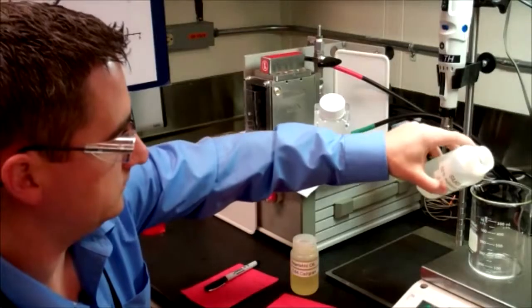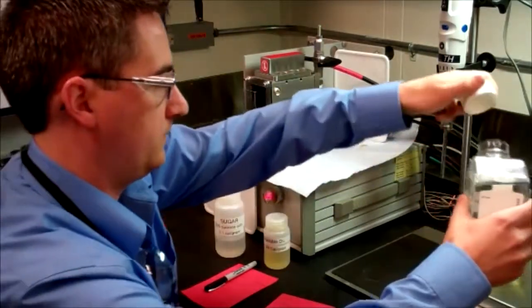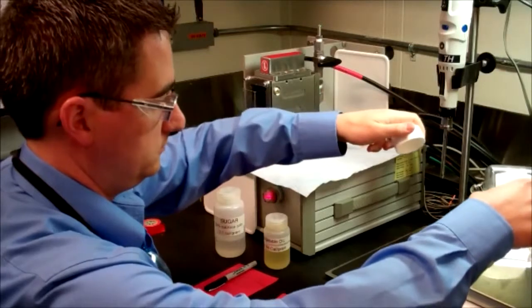Biologist Matt Webster starts by weighing a sugar solution, vegetable oil, and water, then combines them to simulate an actual food item.